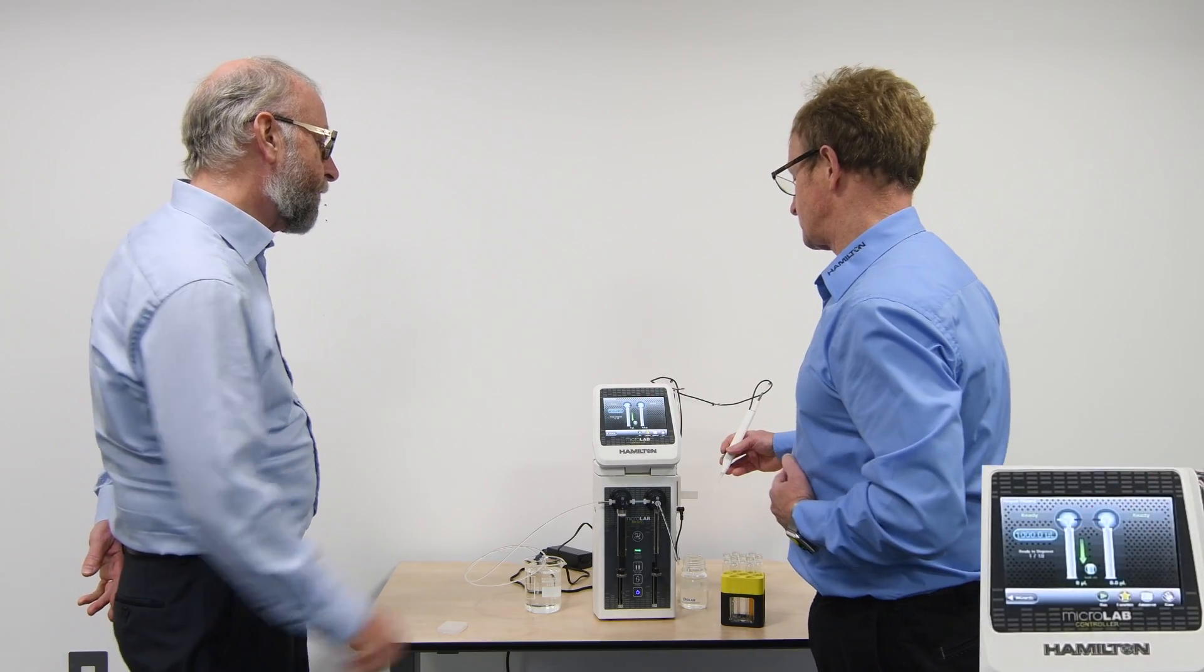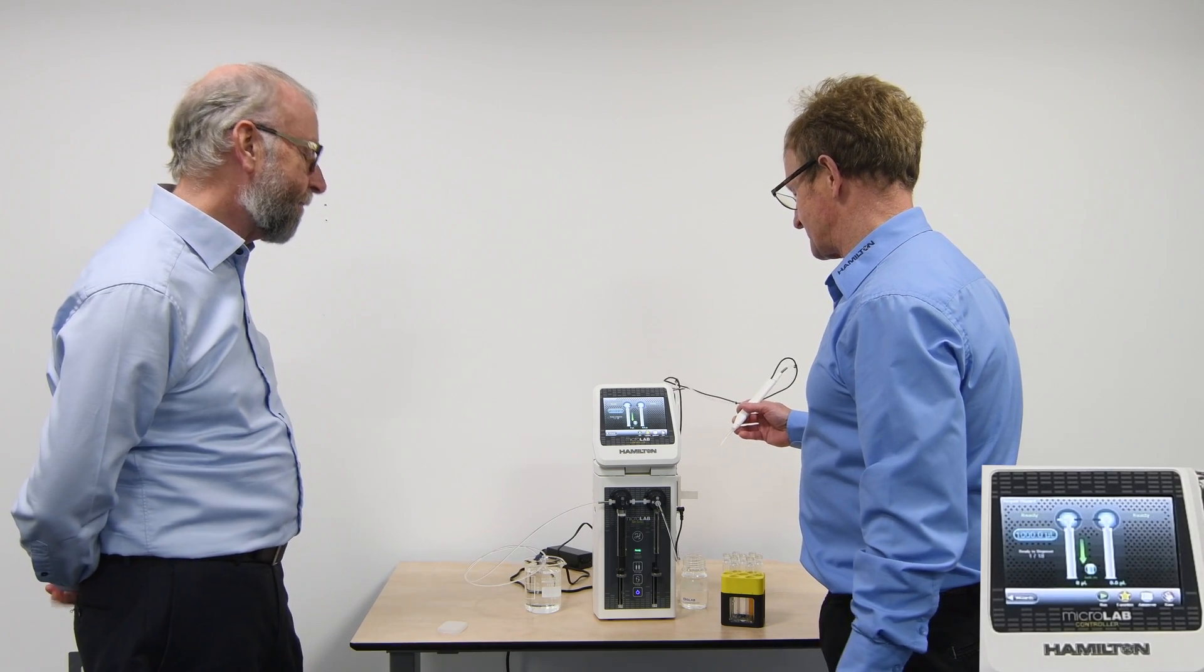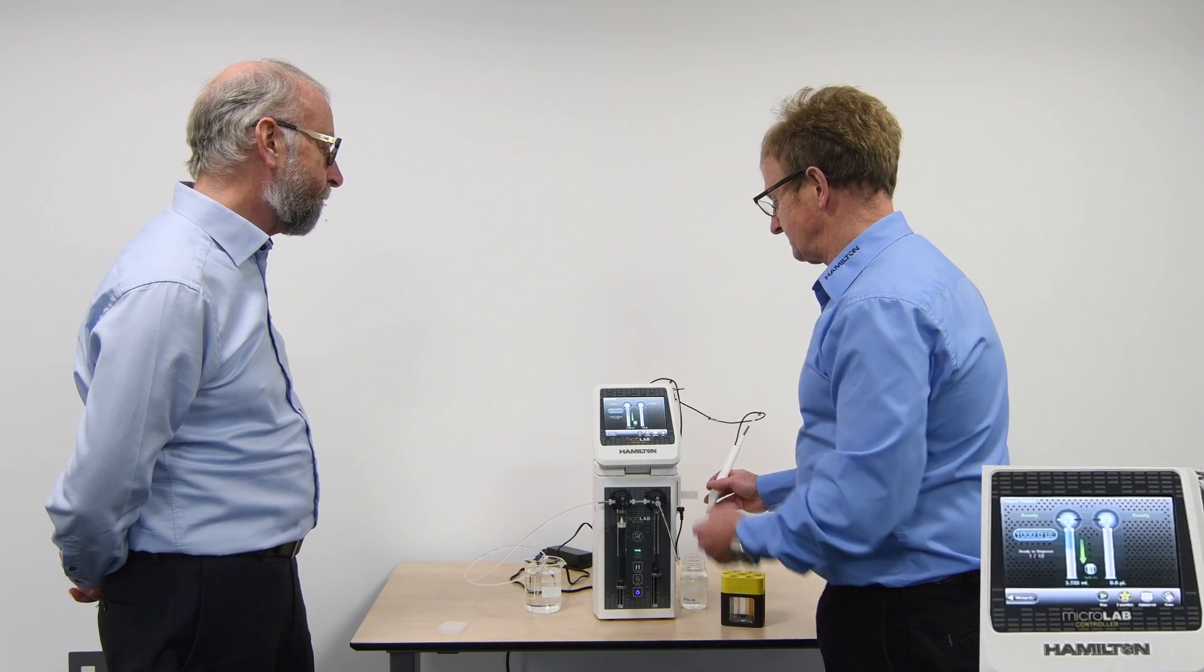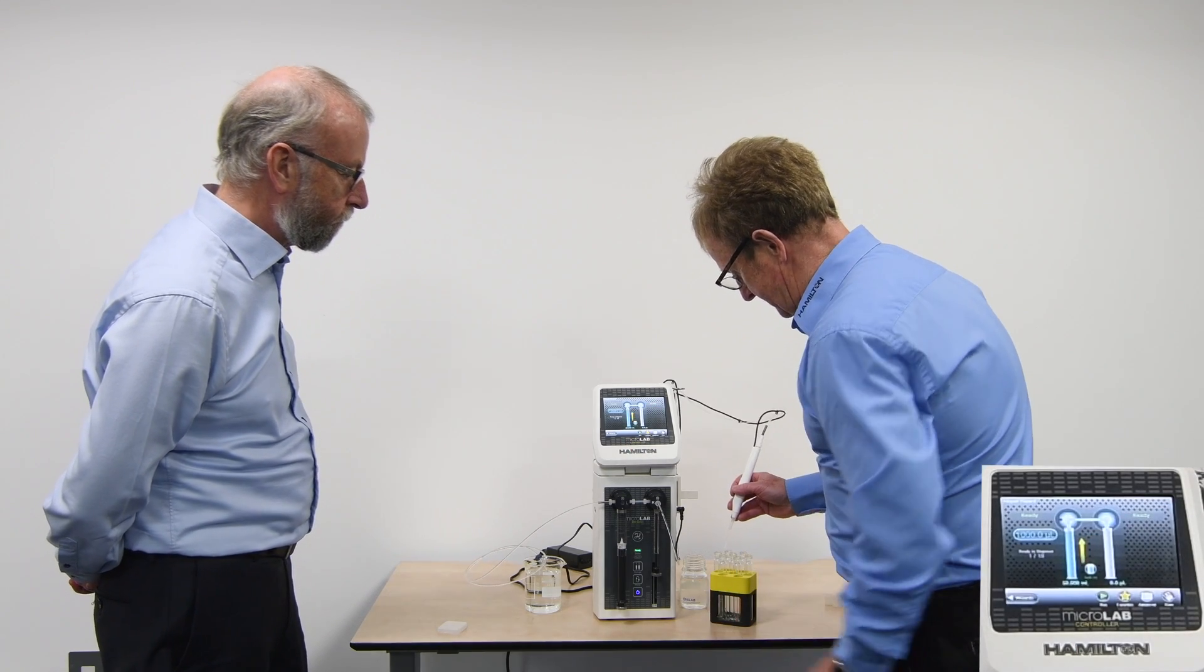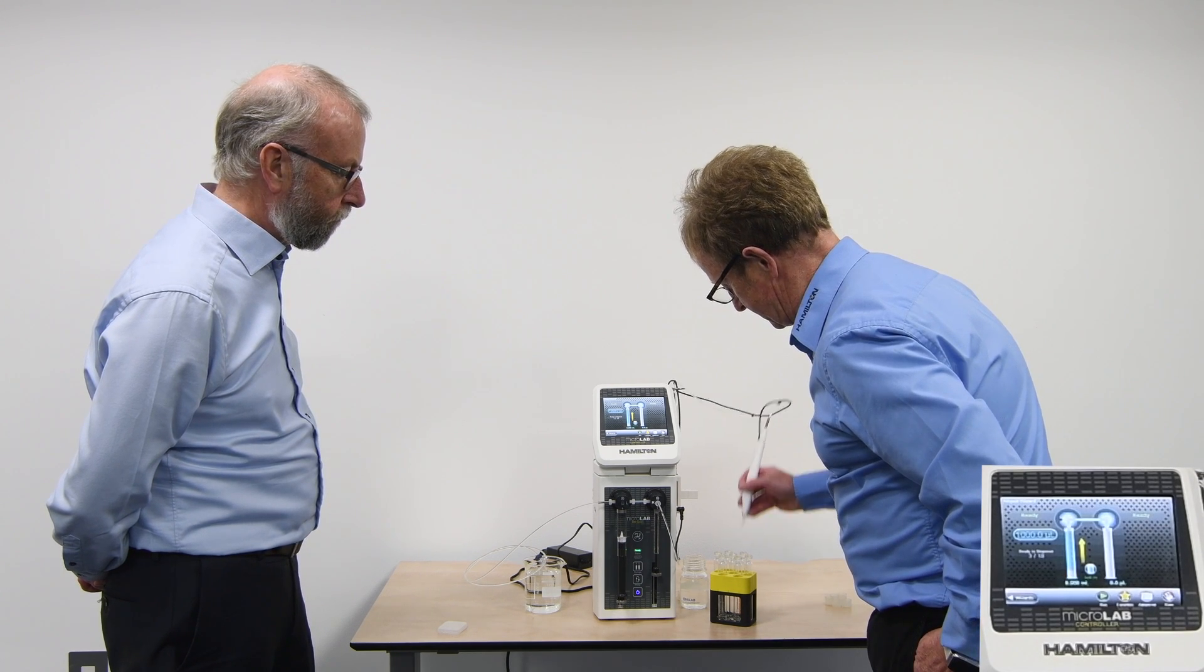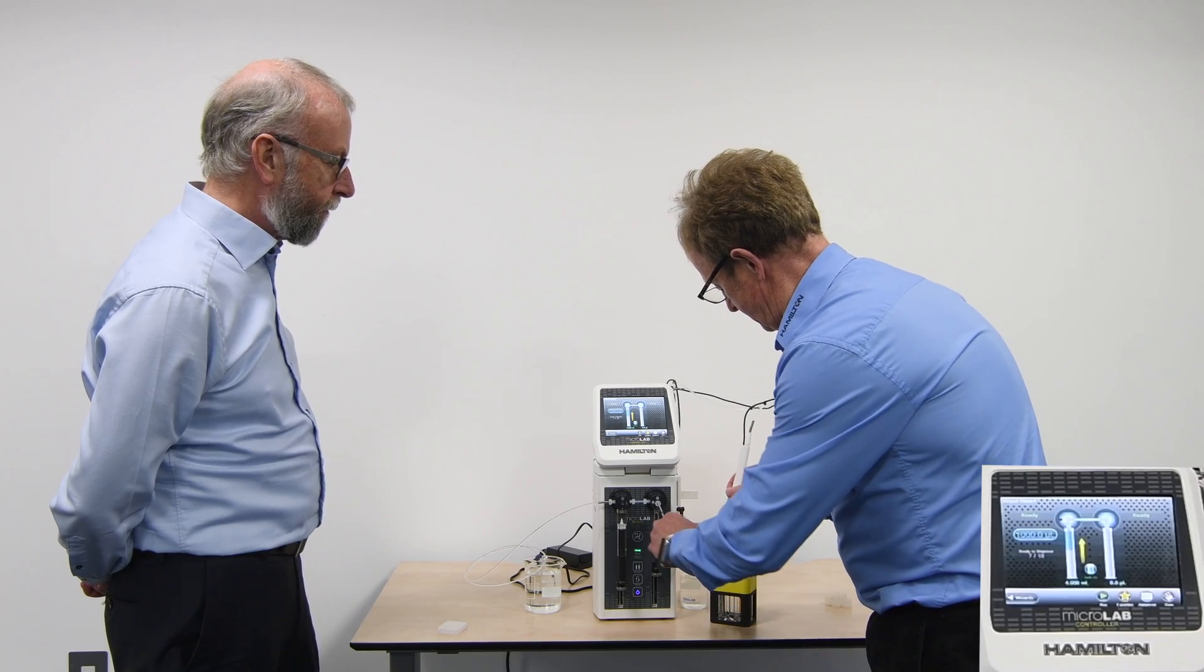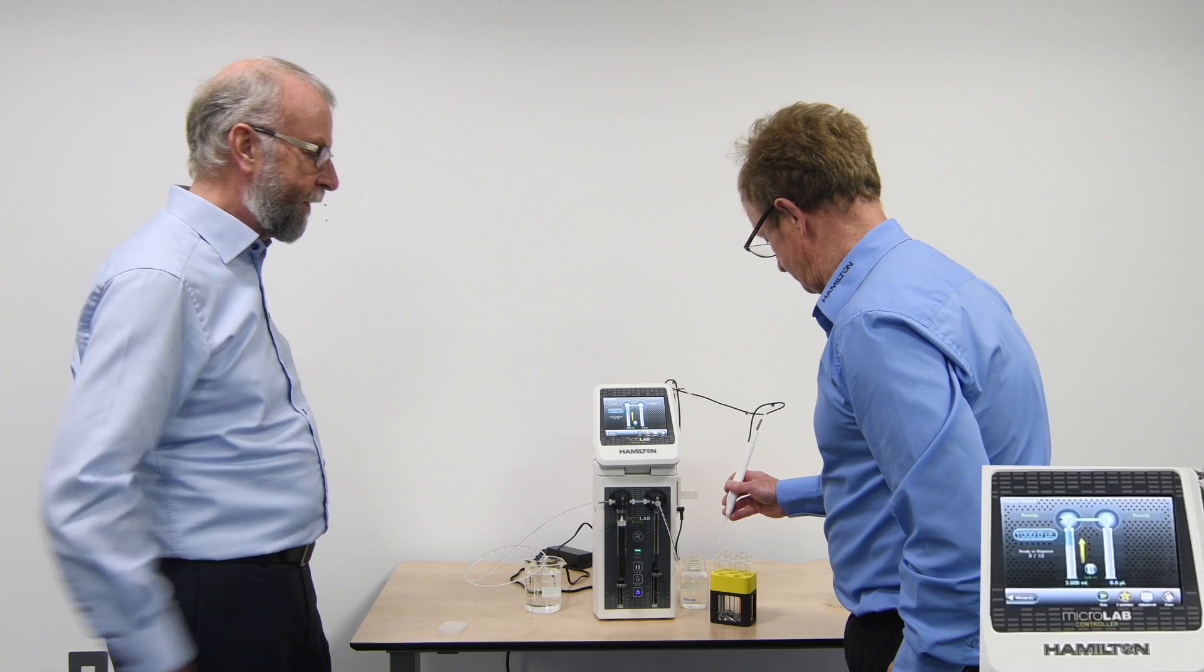So again, first step for sure. So it'll keep refilling as long as I'm pressing the button on the probe. Exactly. You're in control of the system. So first stage, it will actually work to pick up. It's looking to aspirate the first amount of reagent. 10 ml is here. And if I was to be filling these containers, I'll actually press and dispensing each time I move in. I can dispense the 1 ml that I've requested. And I can do contactless dispensing as well, depending on the liquid and the volume.